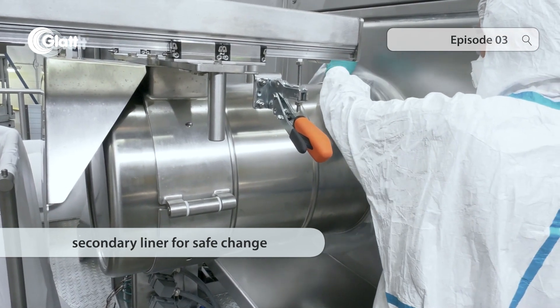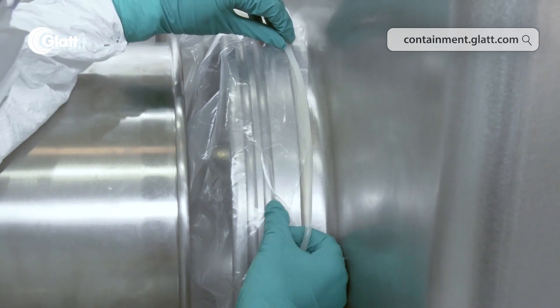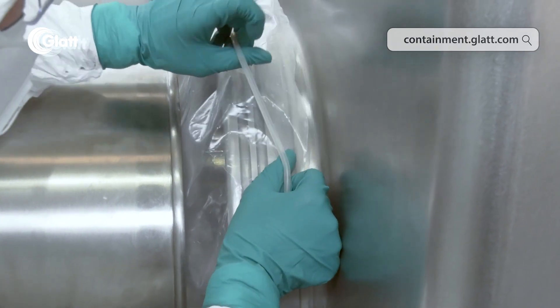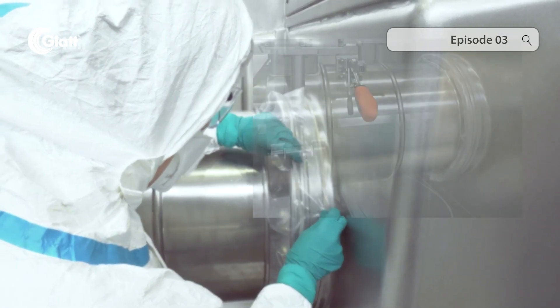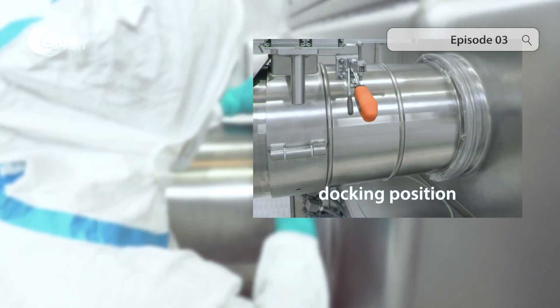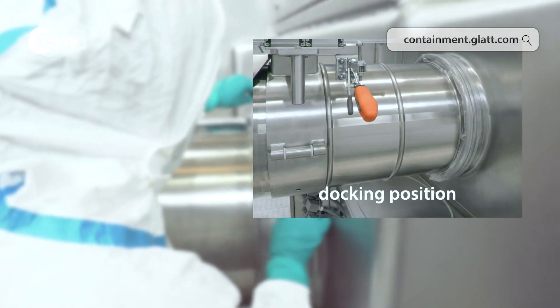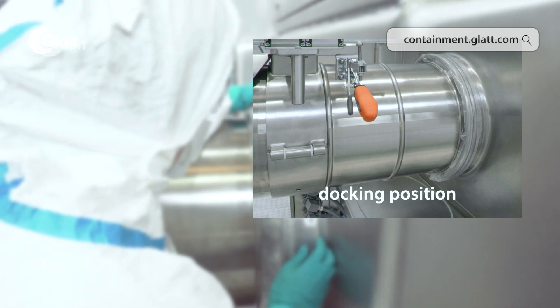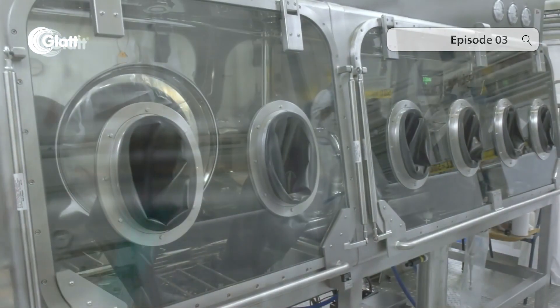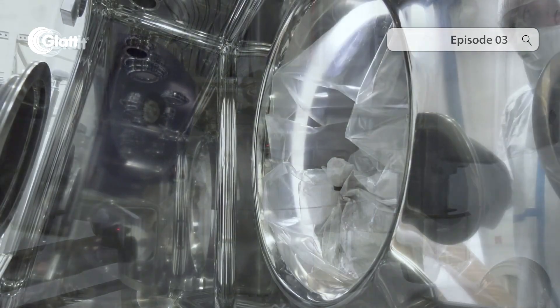The outer liner is attached to the isolator housing with an O-ring, protecting the operator from direct contact with the contents of the drum. The inner liner containing the product can then be pulled into the isolator and the product can be shoveled into the IBC.